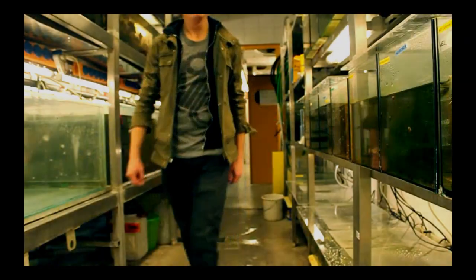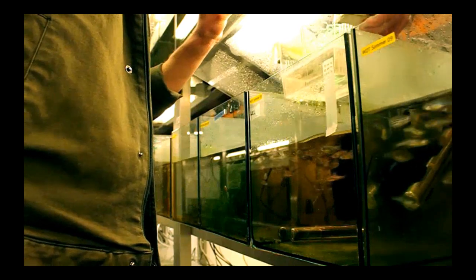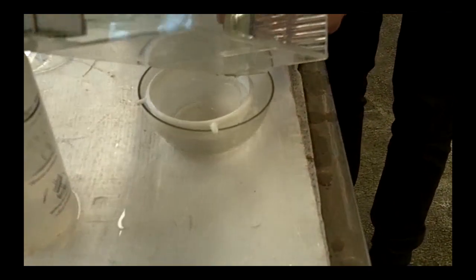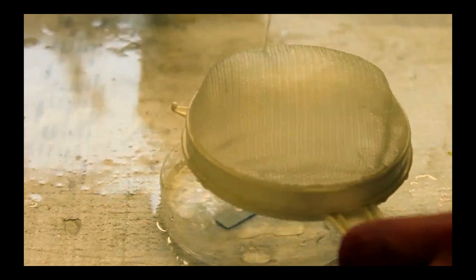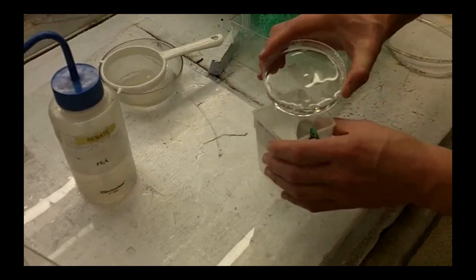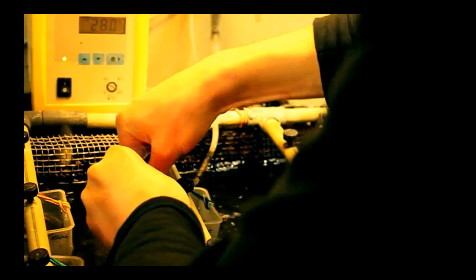On the next day, when the fish spawned, eggs that fell through the grid could be collected from the basket's bottom. The eggs were then filtered through a sieve and washed with aquarium water, then transferred to small beakers and put into a temperature-controlled water bath at 28 degrees Celsius.